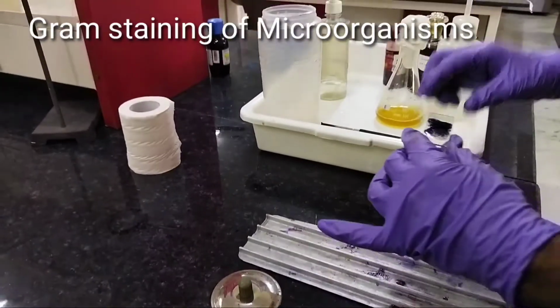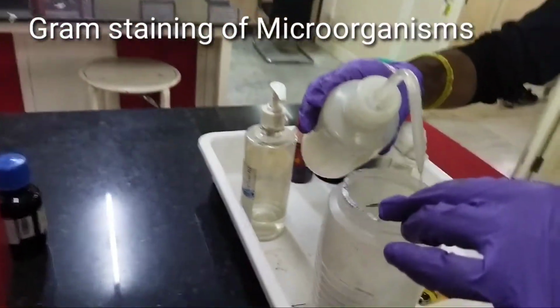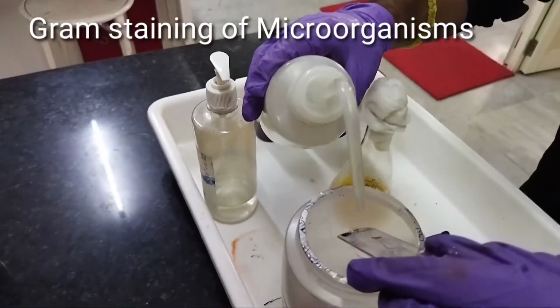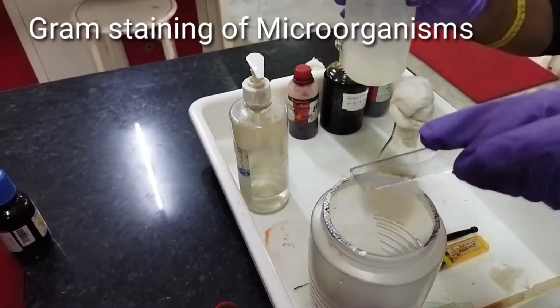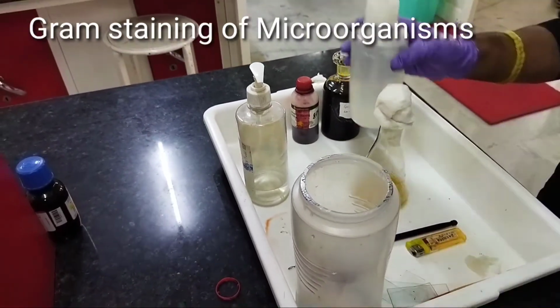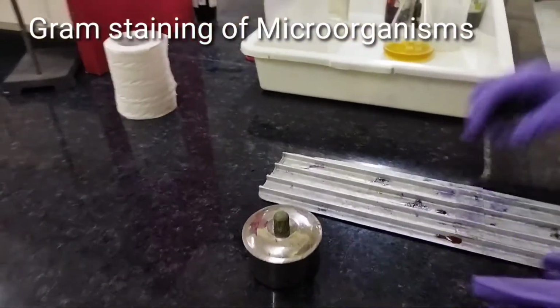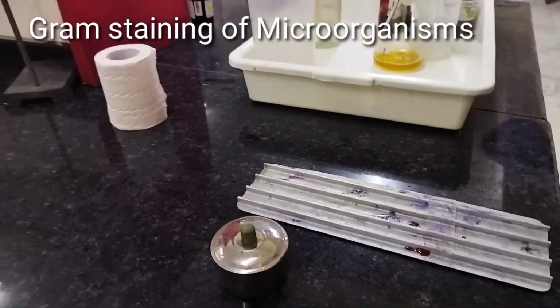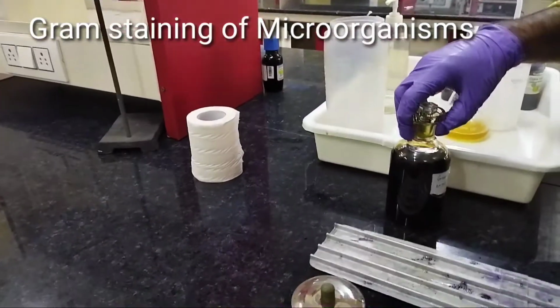After 1 minute, we will wash the slide using a gentle flow of distilled water, because we have to remember one thing, that the bacteria must not be removed from the glass slide. Now we have washed this slide.